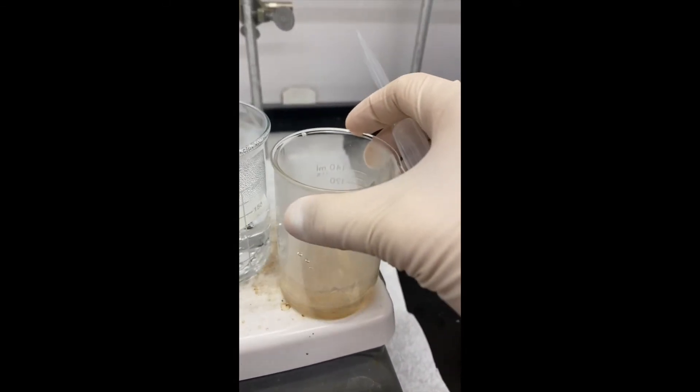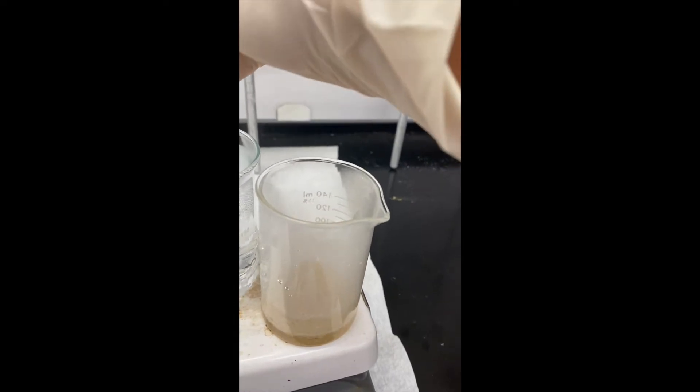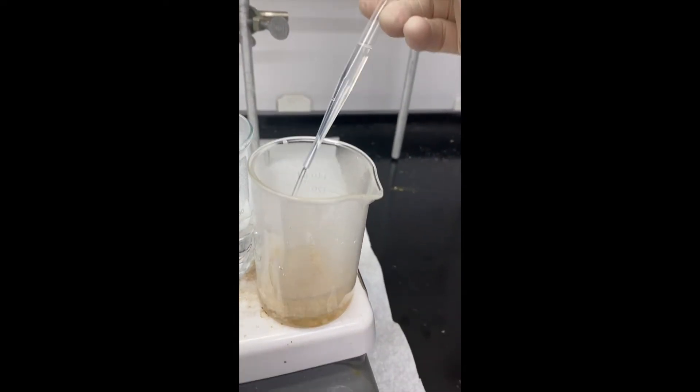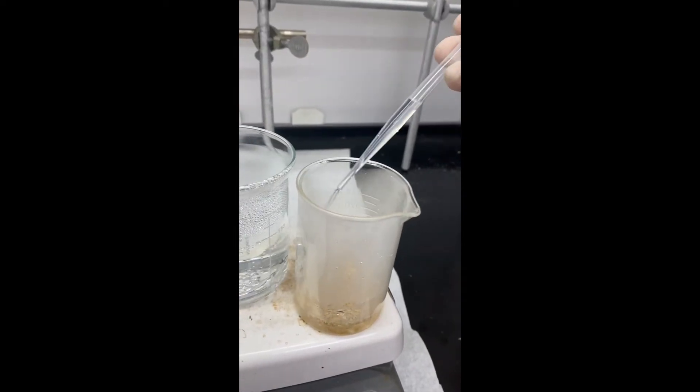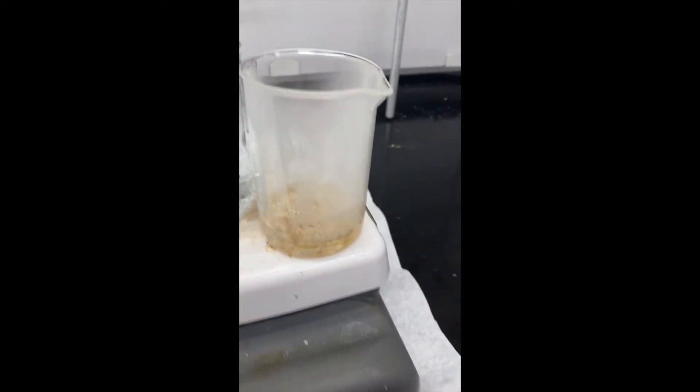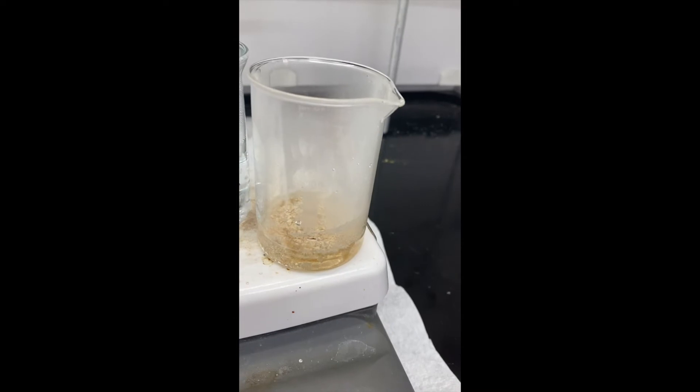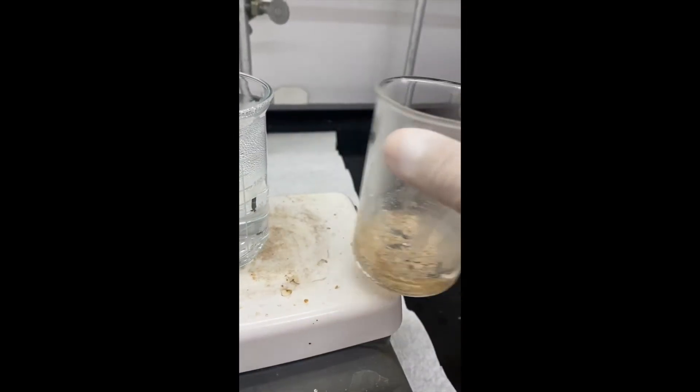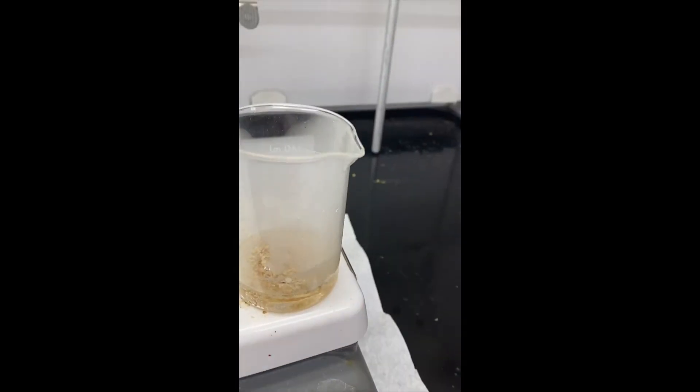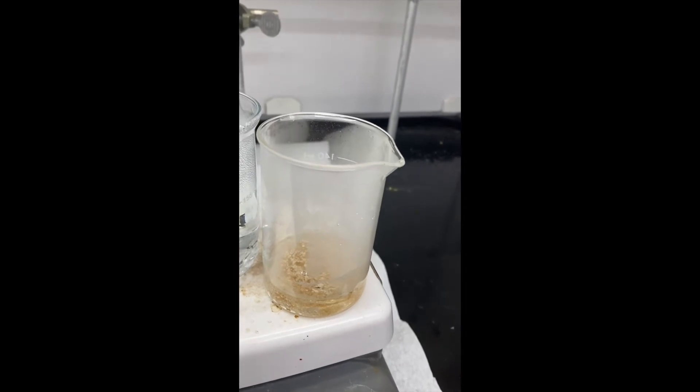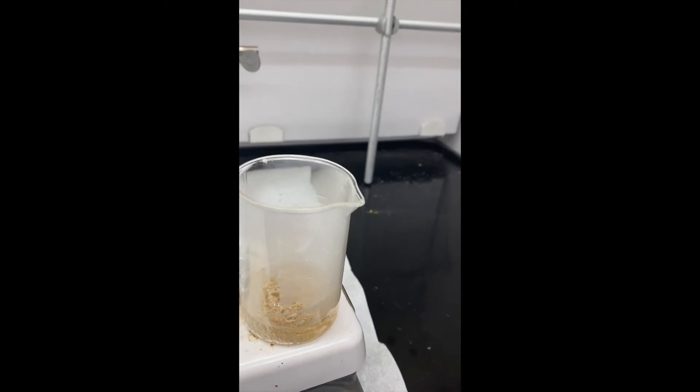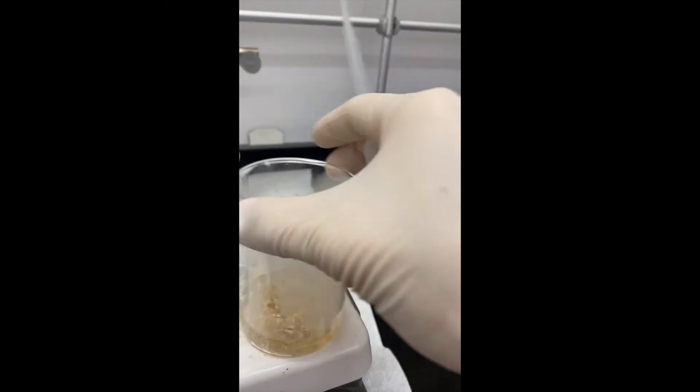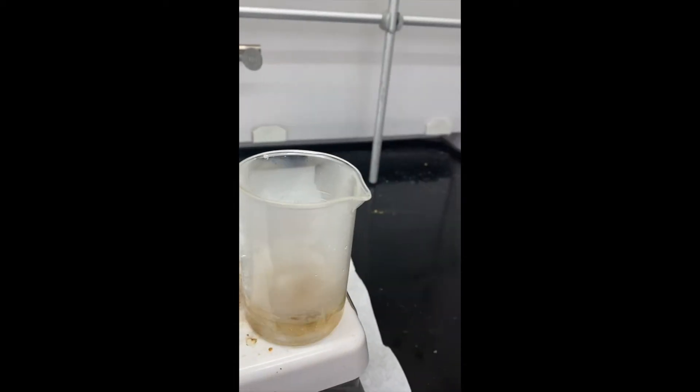A common mistake of students when they're first learning recrystallization is to add solvent enough to just dissolve that solid. What happens is when we take this off the hot plate, we let that cool, our crystals will crash out of solution, but they soak up all of the solvent. So there's not much solvent left over to filter from.